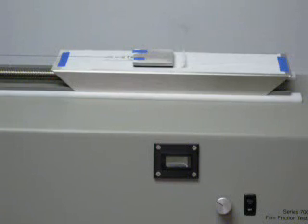Remove the film or sheeting specimen from the sled and from the horizontal plane. The apparatus is now ready for the next set of specimens. Measure and record the average thickness of the test specimens in the area of testing.